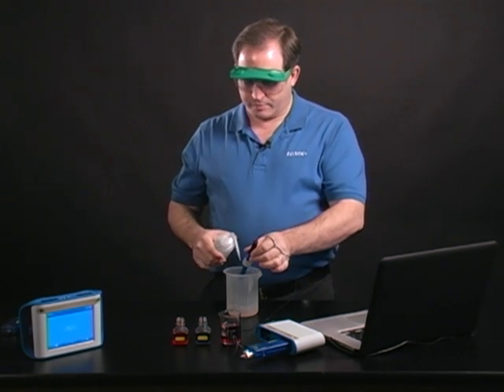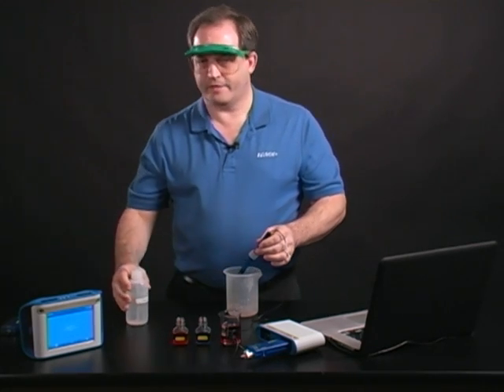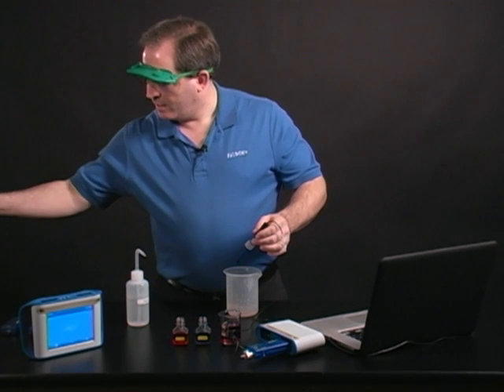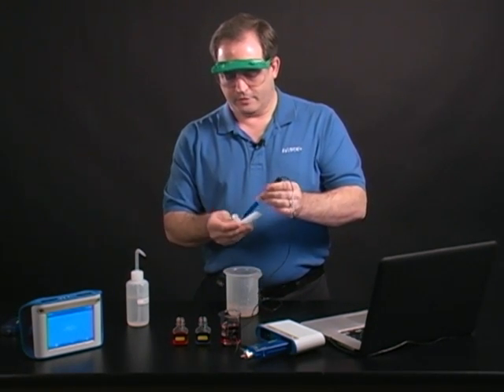The first thing I want to do is rinse off that probe to make sure it's good and clean and doesn't have any of that fluid still on it. I can blot it dry to keep it from diluting the solutions I use.